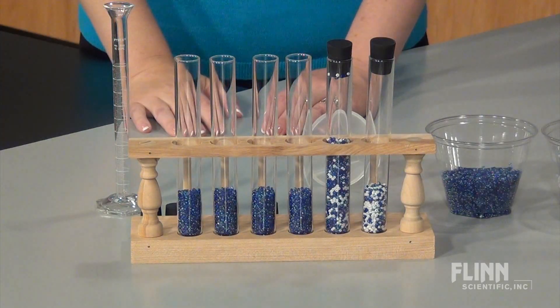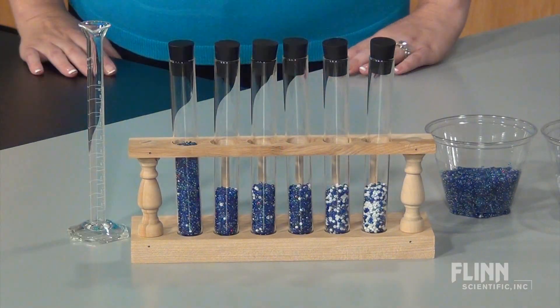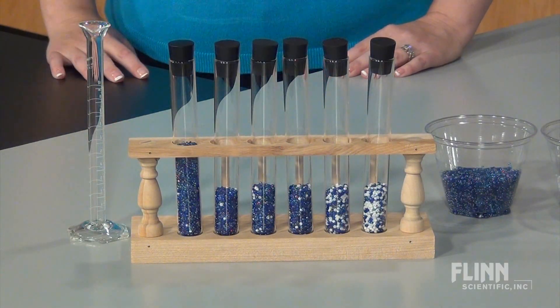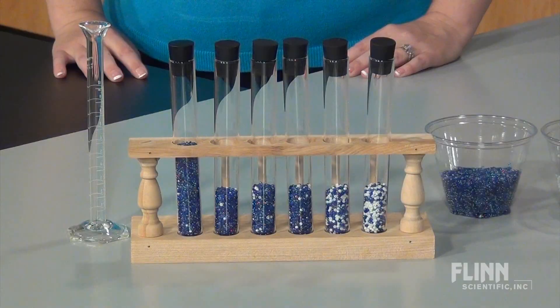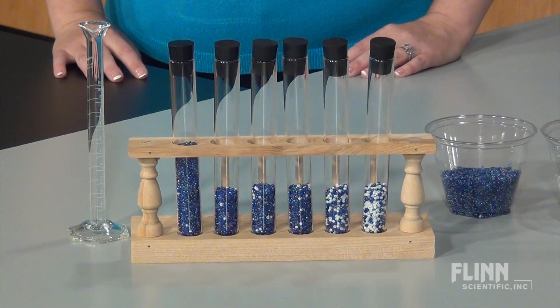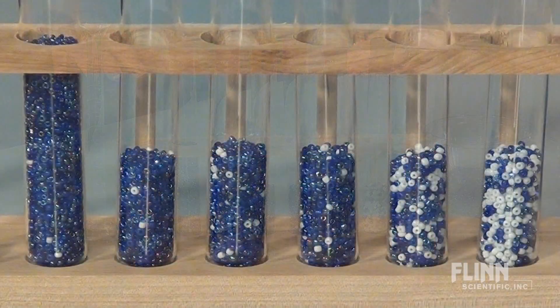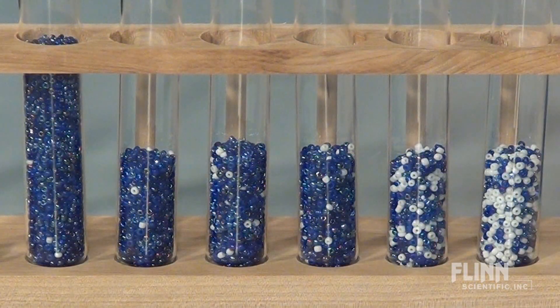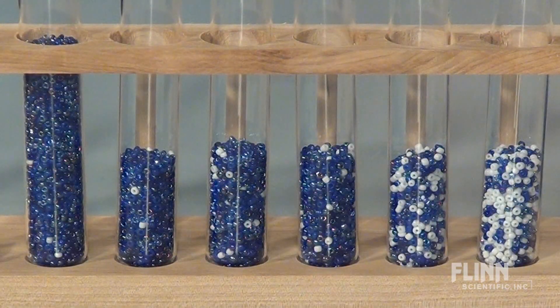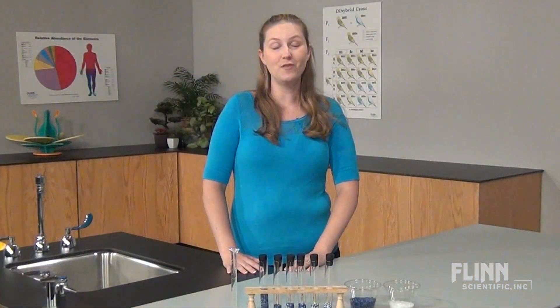Repeat for each of the next four test tubes. The sixth test tube is a one percent solution of white beads. If desired, the dilution can be continued to model one part per million.